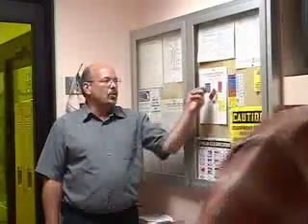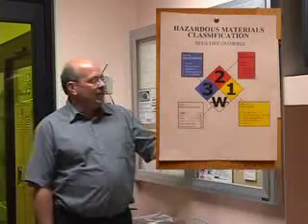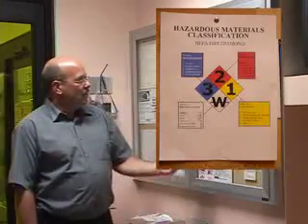The other one you'll see quite a bit, that gives you a quick visual indication of properties of a chemical or sometimes materials, is the NFPA fire diamond. You can see the fire diamond is color-coded for different categories or classifications of materials, but also the number is an indication as to what level within that category.